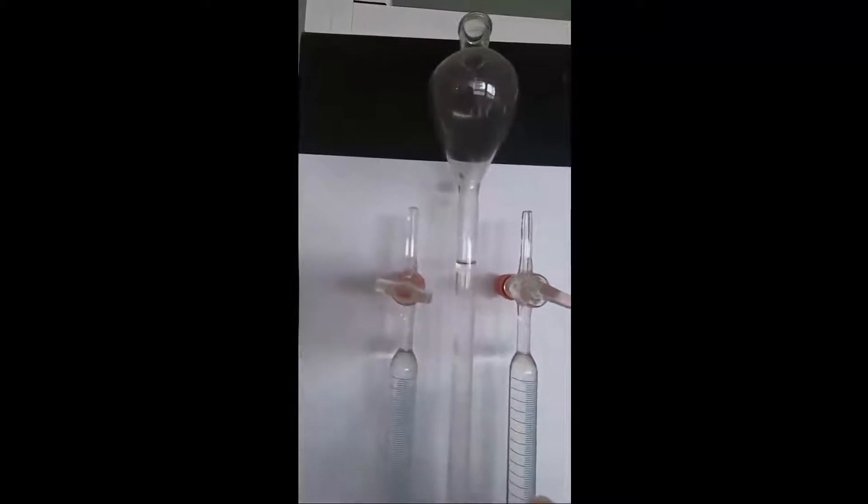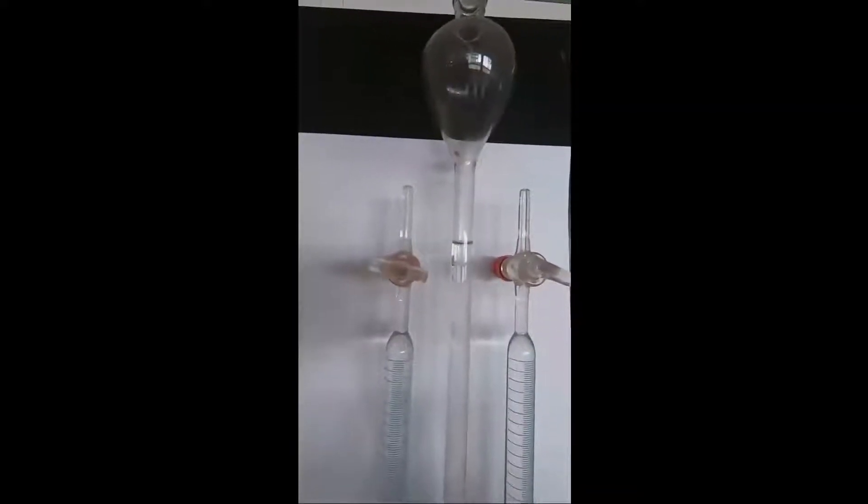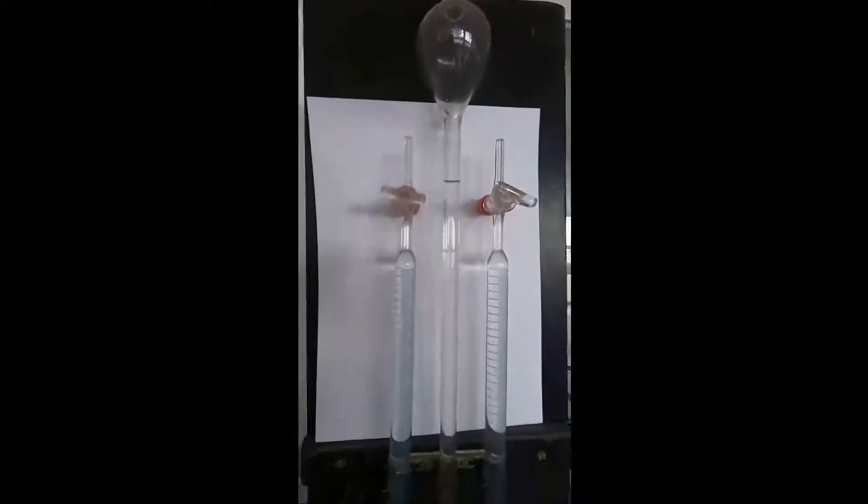These two tubes are completely full of water. They're joined across the bottom, and here we have what we call electrodes. They're actually made out of platinum—platinum is a very unreactive metal but a very good conductor of electricity.